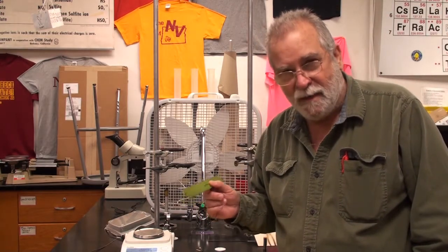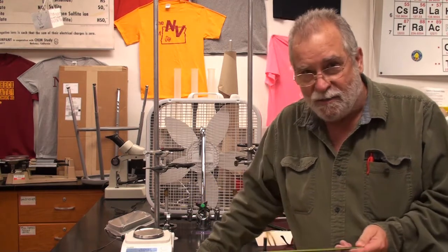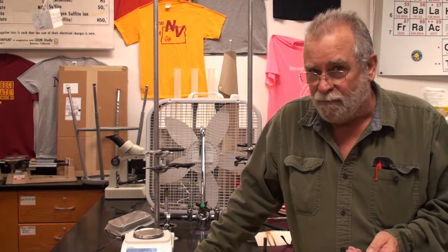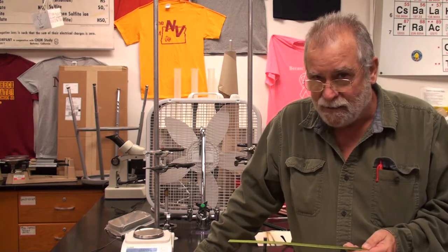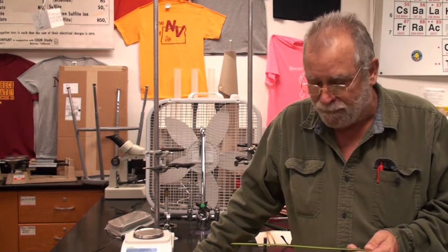We're going to look at measuring density today, or calculating density. Density, as you may know, is mass per unit volume. That means you have to measure the mass, calculate the volume, and then do a calculation, mass divided by volume, to get the density. Density is one of those derived units. It's a unit that has to be derived or calculated in order to get.